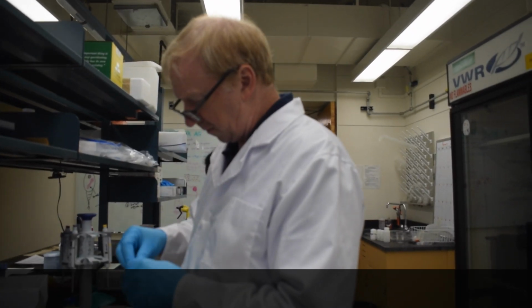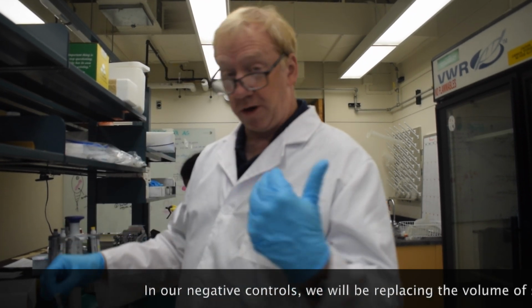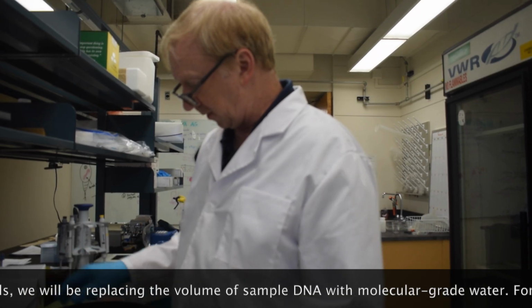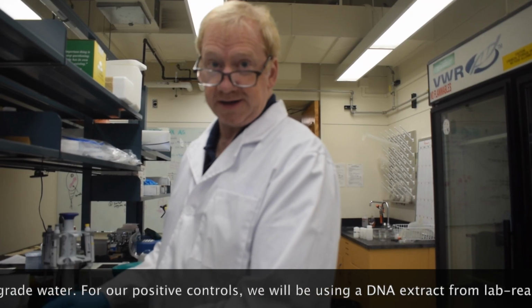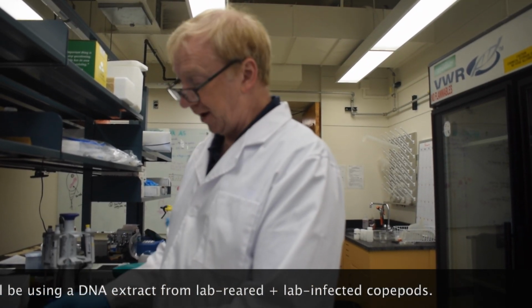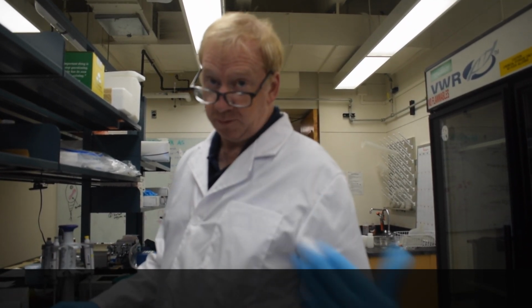What about negative controls? What would I put in there if I'm not putting DNA? 8.8 microliters of the same water that we use in our master mix. Are you going to use a positive control? Yes, we are. We have a sample that is 100 copepods infected, each with one Schistocephalus worm, and we have DNA from that extraction that we will use as our positive control for both copepods and Schistocephalus.